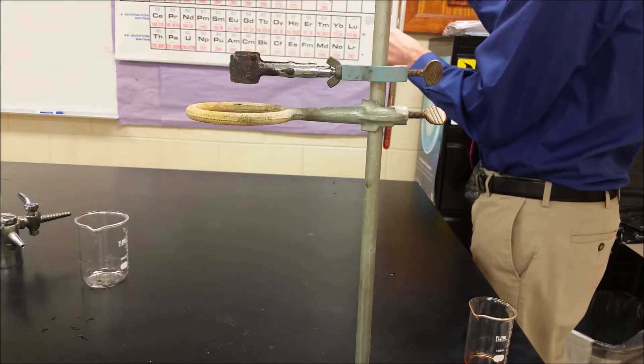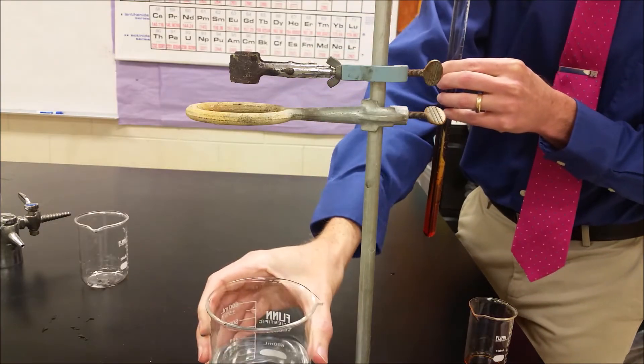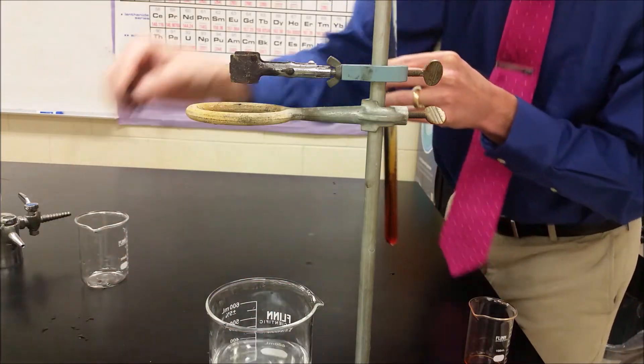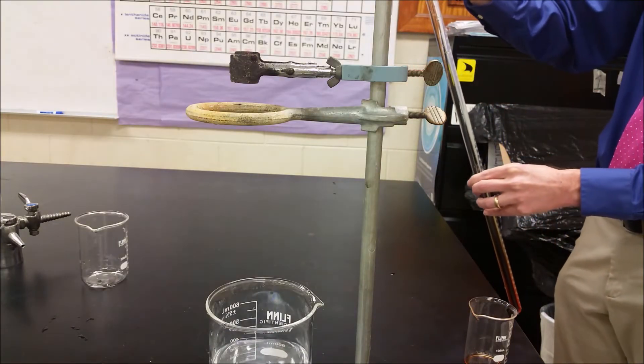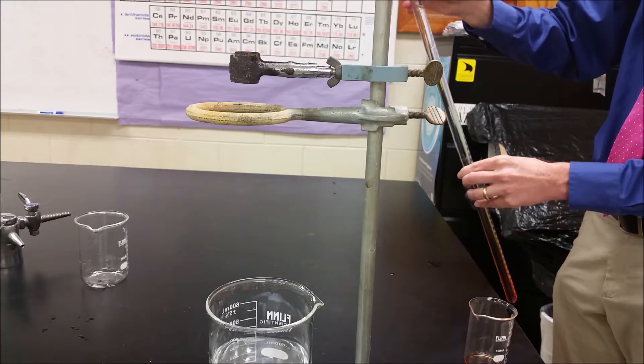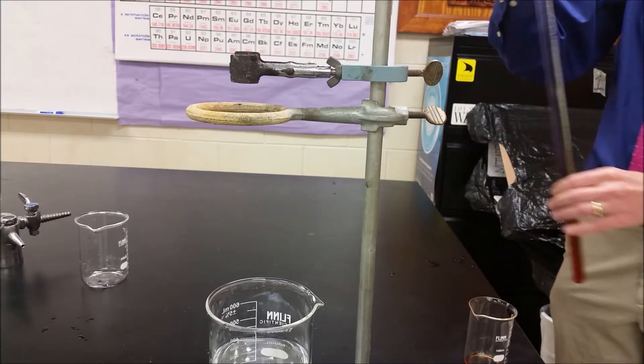It was a little short on water so now we're going to add just a little bit and fill it all the way to the top so it's going to flood over, but it's not the hydrochloric acid at the top because it hasn't had a chance to mix evenly. We're just going to let the water flood out of the top and seal that with our one-hole stopper with the copper wire and the magnesium sealed inside.